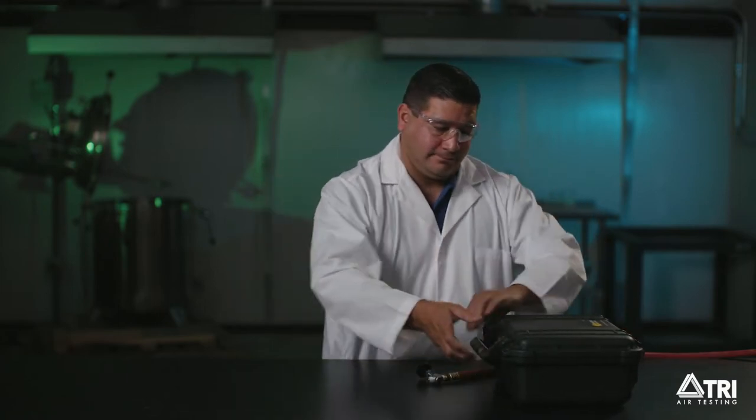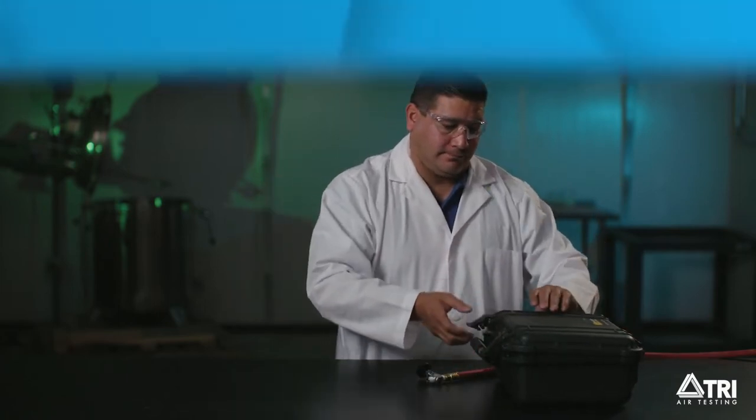This is Sam. He's going to walk you through how to take a mold and bacteria sample with the Champion 35 test kit.